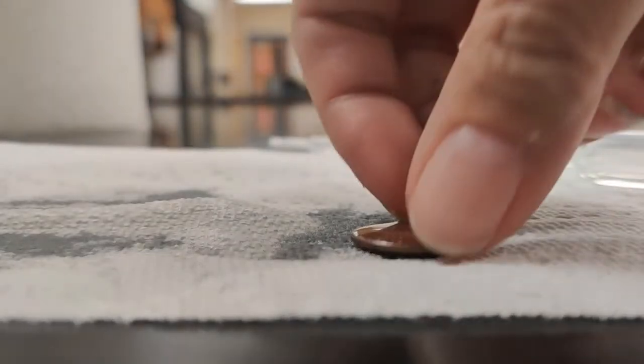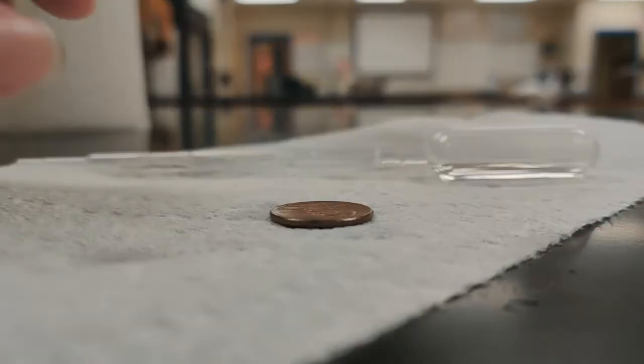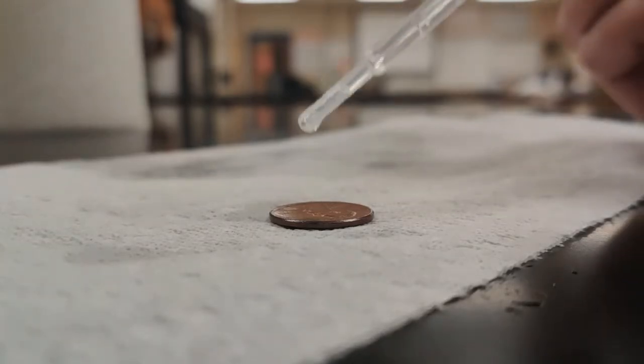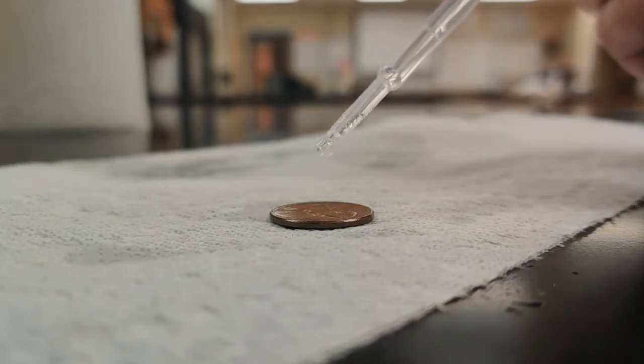So you can see why we're doing these multiple different trials, because sometimes one trial is much bigger or smaller than another one. And so we'll do our trial 4 here. Really, I probably need to slow down a little bit because I know I'm kind of rushing. I'm not really giving it much chance to settle. So maybe I'll try doing this one a little slower and see if that changes my results.